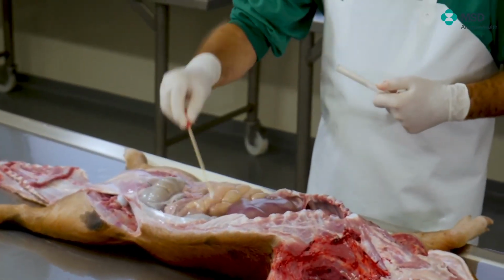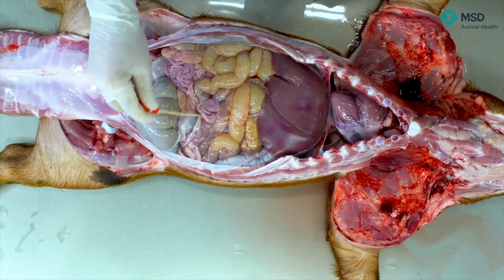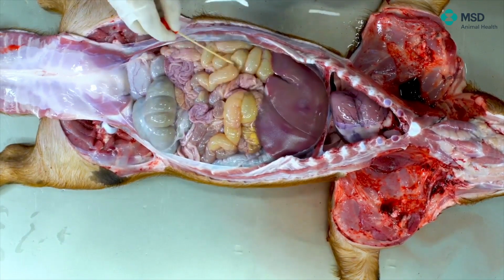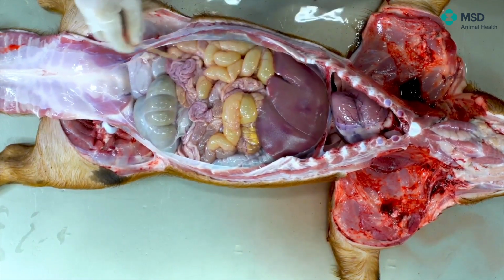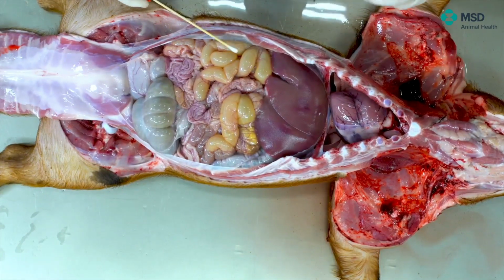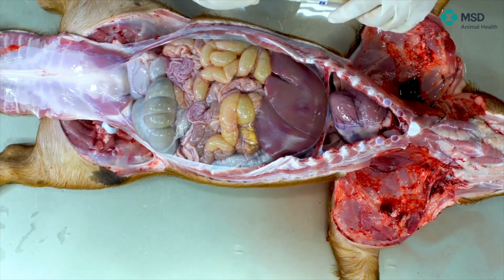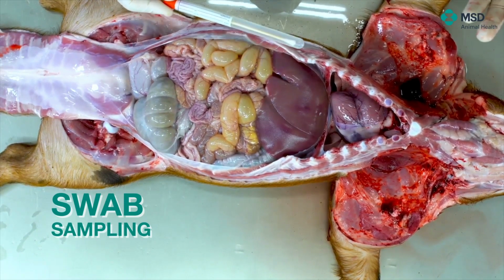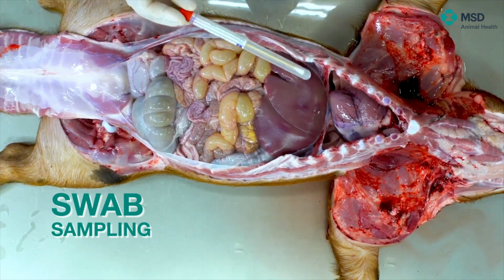of course, as you can see, we have not touched at all the thoracic or abdominal cavity. Of course, with a different one, we will do exactly the same for the thoracic cavity, but then the sample is there and it's ready to be submitted to the microbiological department. Of course, we will have to note and annotate all the data from the animal.